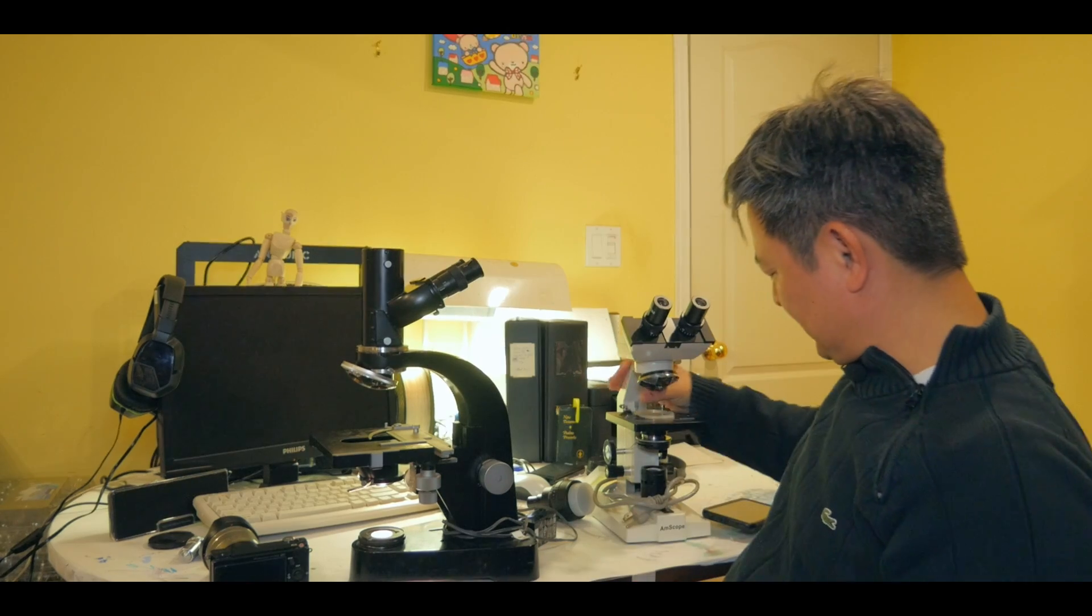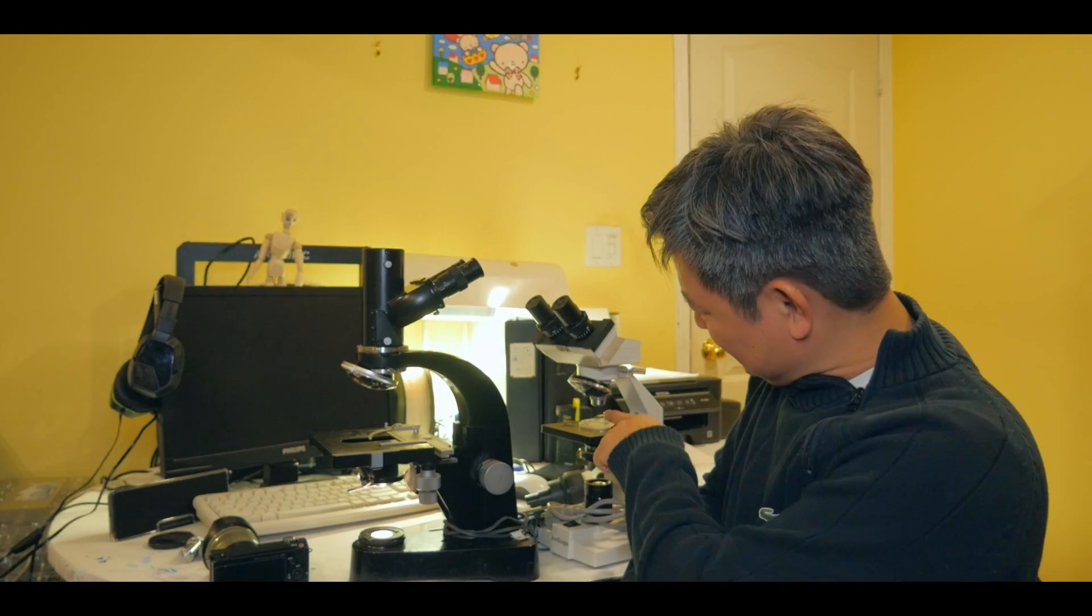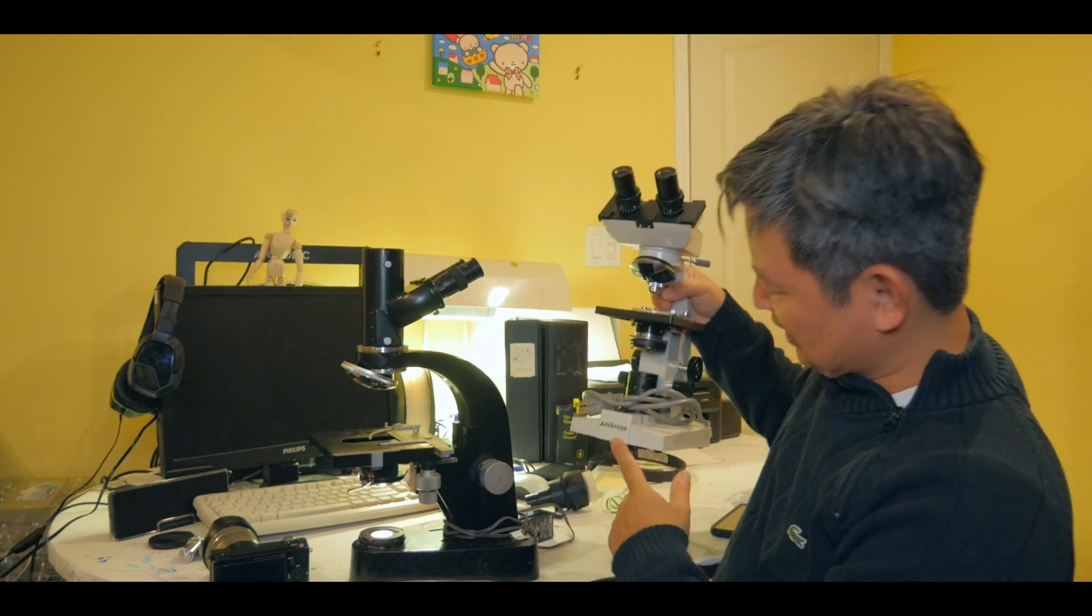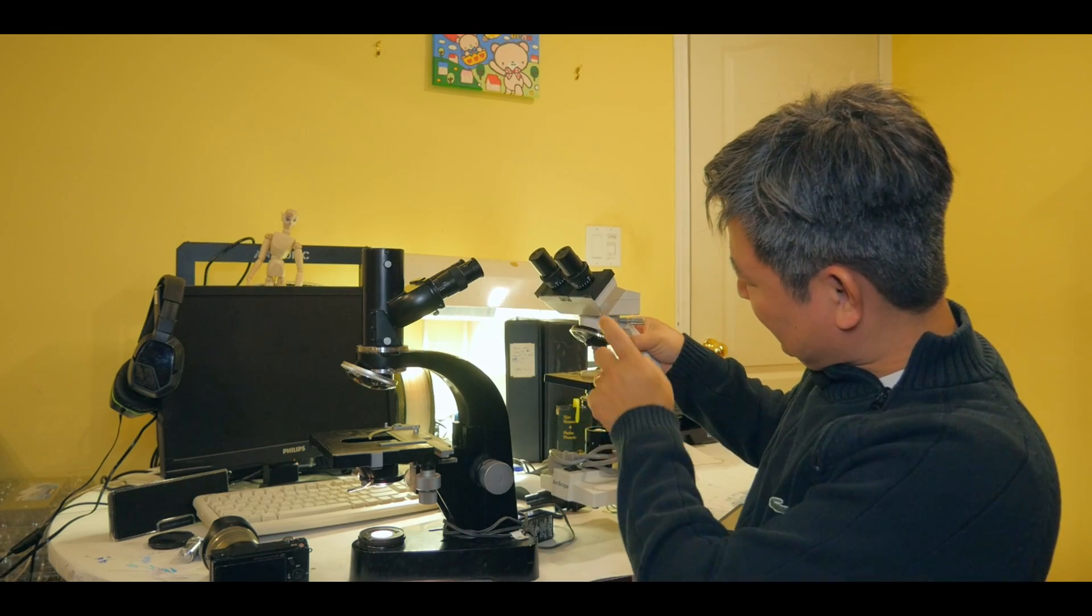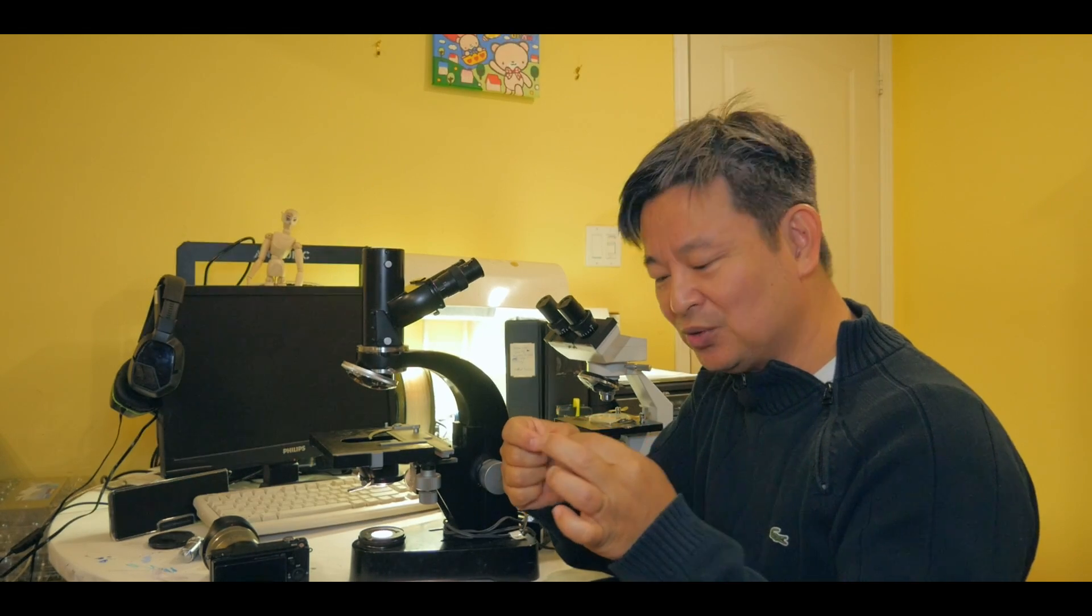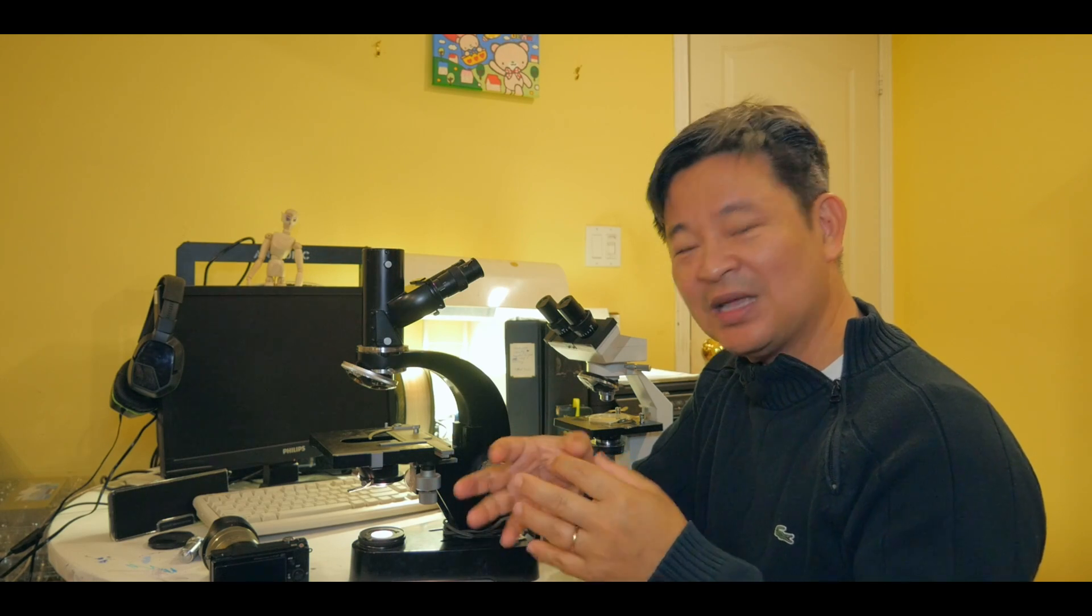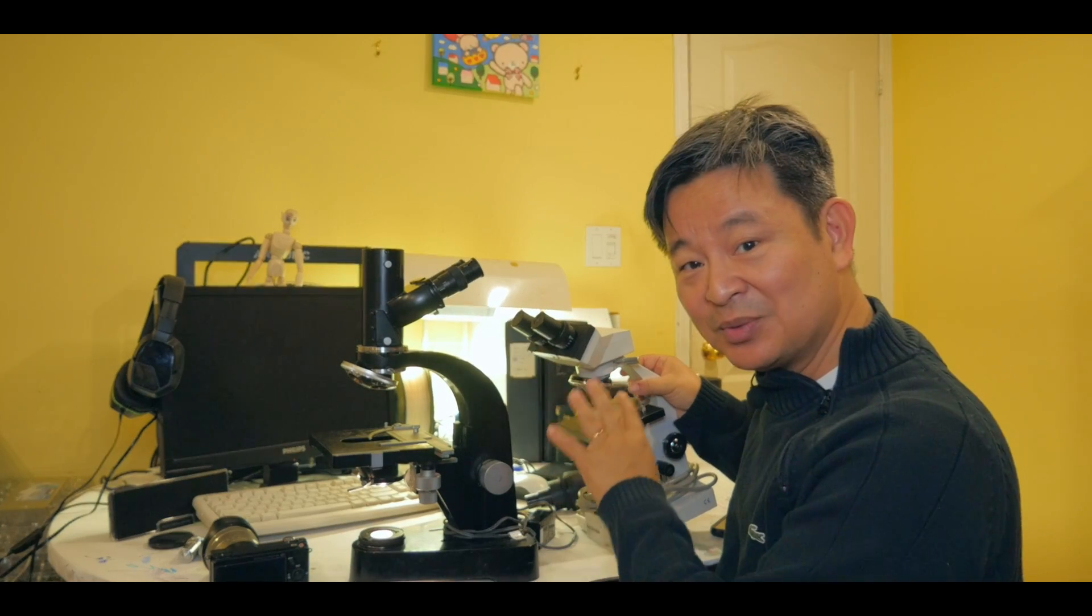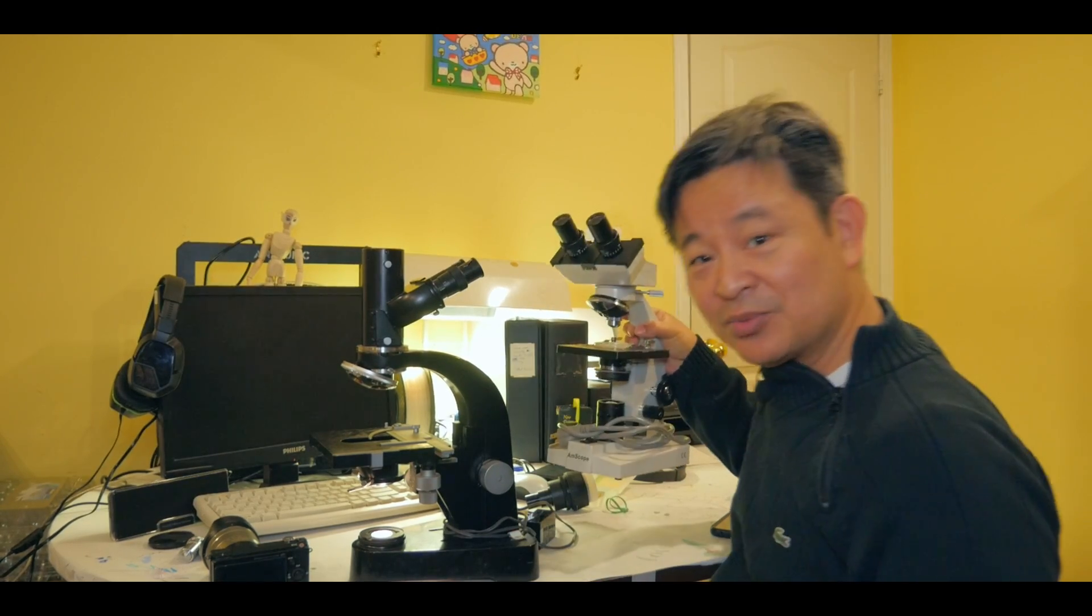So that's why I end up using the same type of objective lens from a no-name brand. Actually, this one is from the, I got it from the Amscope, which is actually not bad. I'll show you the image in a minute. So what I end up doing is that taking this four times Leica objective lens and place it into my Amscope, which is okay. It works really well. I set it up so that now it only had one objective lens. And I can use it to like say, view a bigger object like insects and all that. And I might be able to like using a pin and other type of tools to break apart the body of the insects or other smaller organism and see under a microscope 40 times. Or I actually end up putting 25 times, for 100 times. So between 40 to 100 times just by changing the ocular lens. So there we go. This microscope is still useful.